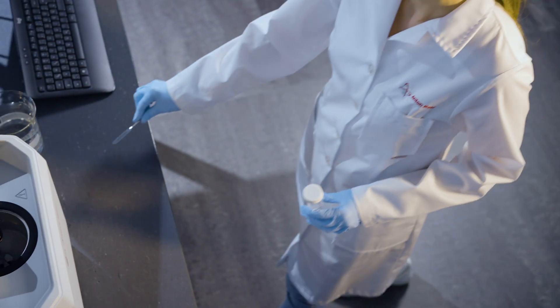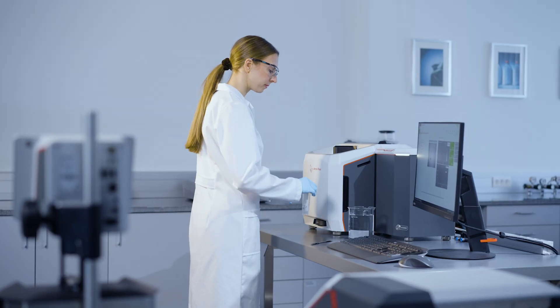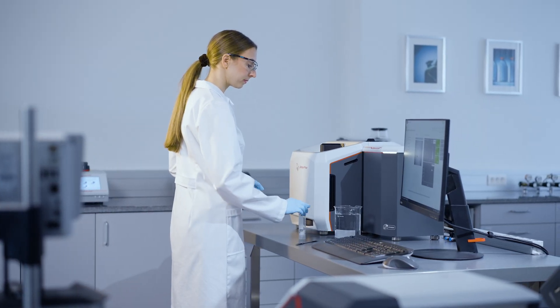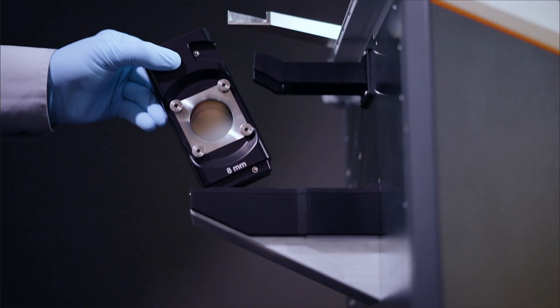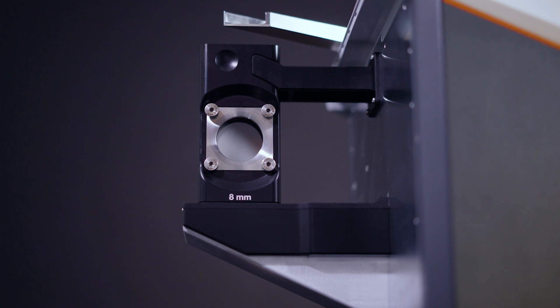It's intelligent, sleek, and easy to use. And with it, new horizons have never been closer.